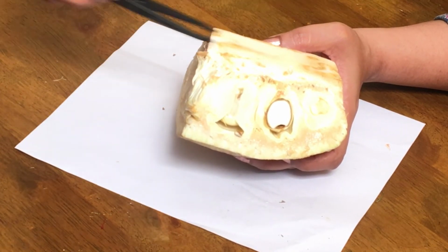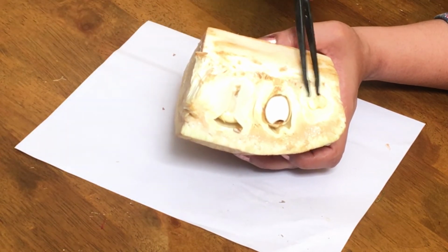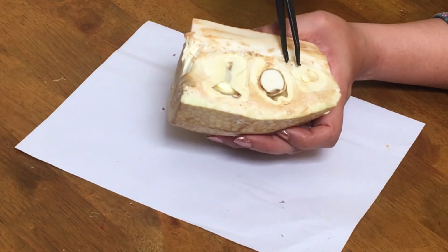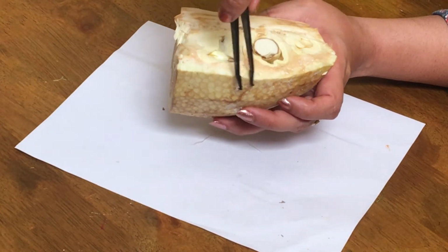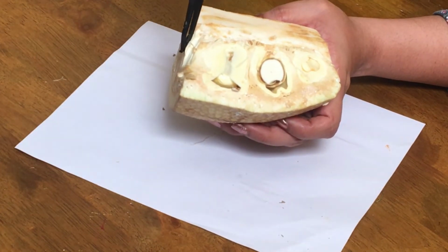And the central axis of jackfruit, which is non-edible, is the inflorescence axis, and these separate compartments that you can see are actually flowers. Now which one is a flower? I'll just take it out and show it to you. And one more thing, outside this it will be green in color and spiny. What are they? They are the stigmas of the flowers.